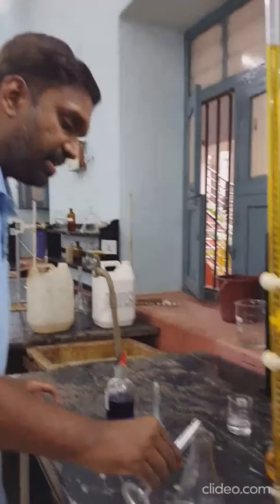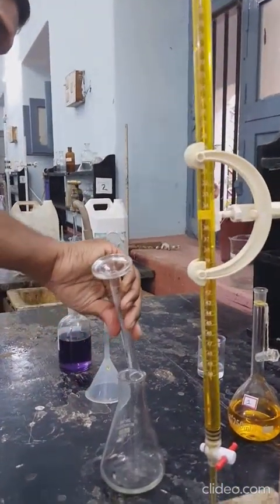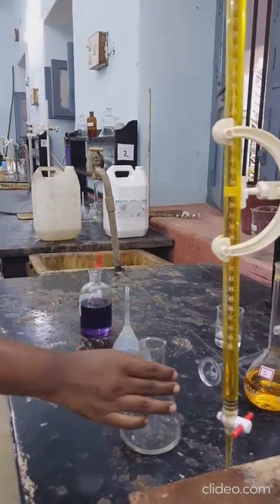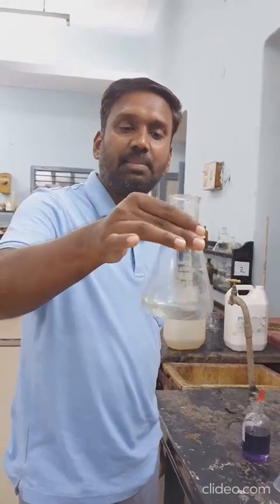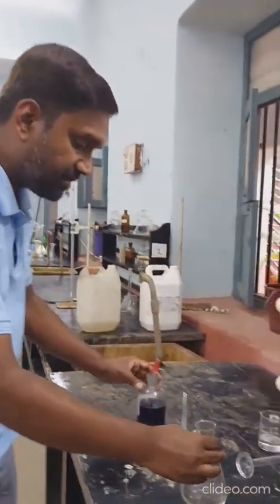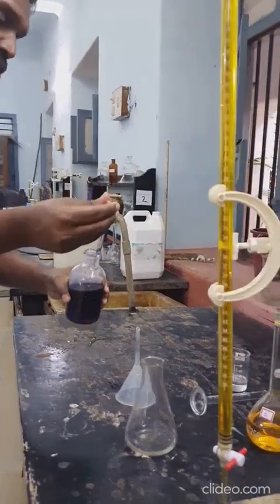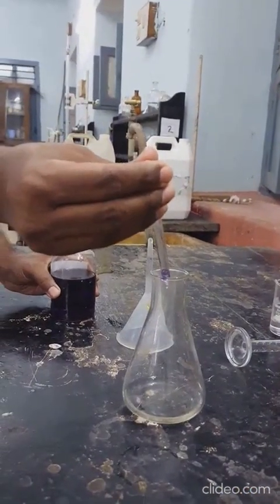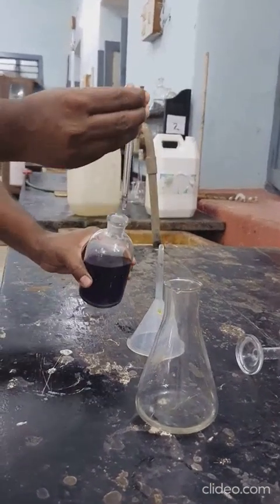Add the acid buffer to the conical flask. Whenever you add a fresh solution, always make it a habit to swirl it for some time so that they become homogenous. Then add two or three drops of indicator - diphenylamine.